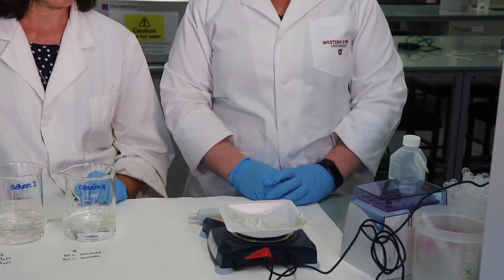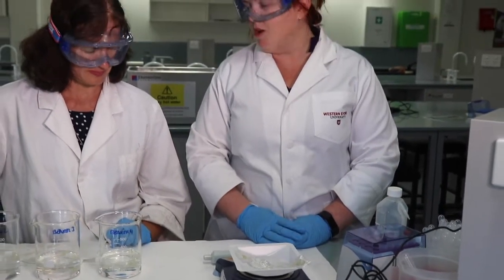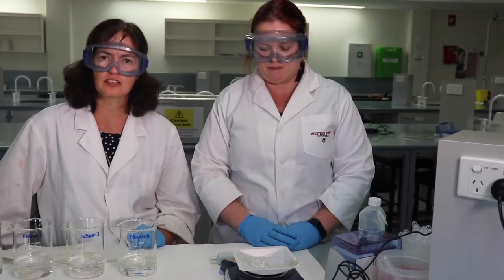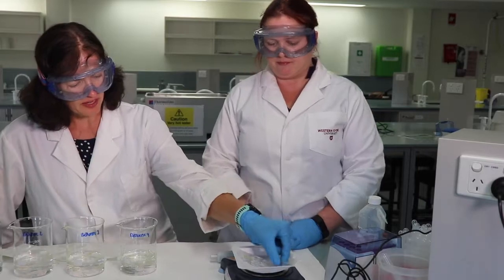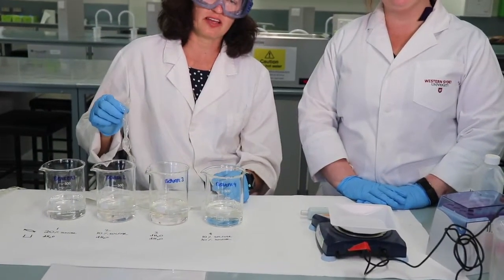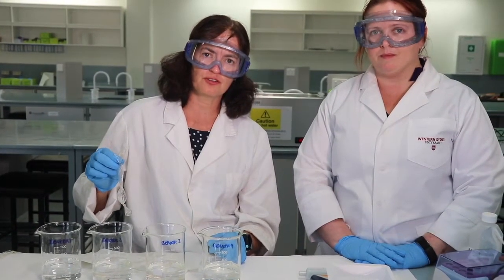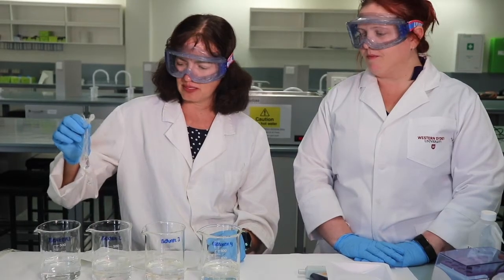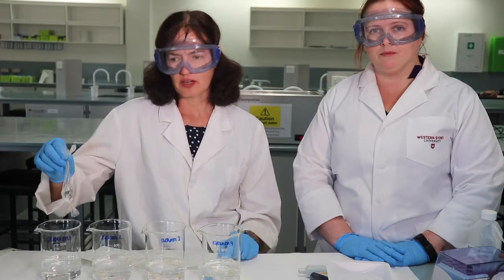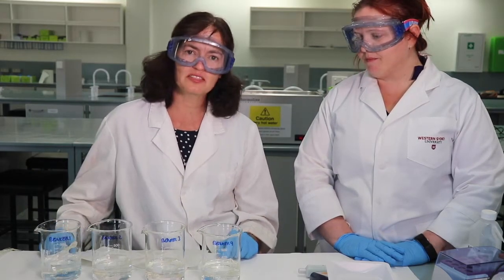Once you've actually got an accurate reading, then you can make that recording in your workbooks in the relevant column. And that bag weighs 15.79 grams. Okay, so we would take the weight of each of the 4 bags at the beginning of the experiment. This is at time 0. So they've been filled with solution, they've been patted dry, and they've been weighed. We would then add all of the bags to the beakers at the one time and start our timer. Yep. And we would time 20 minutes.